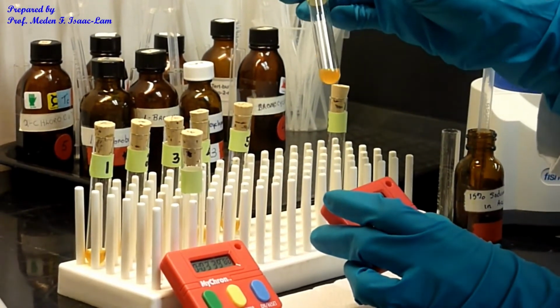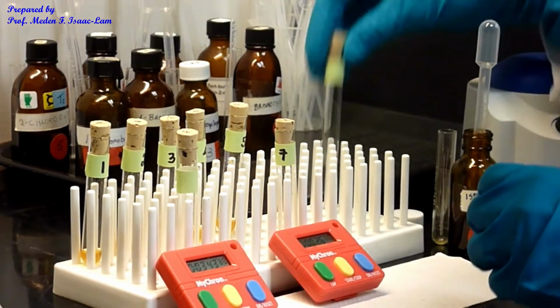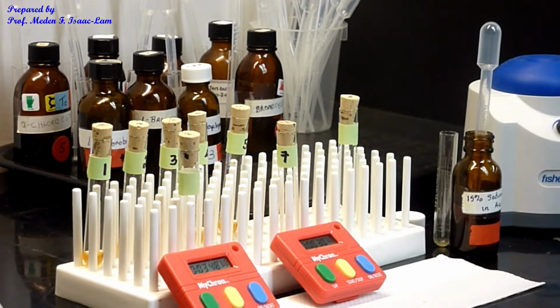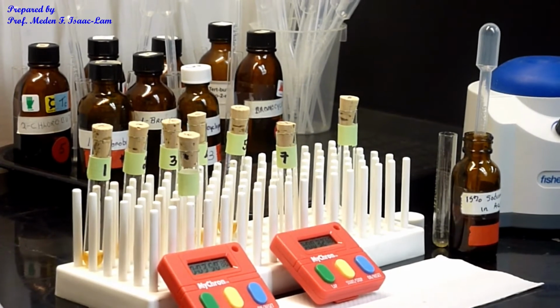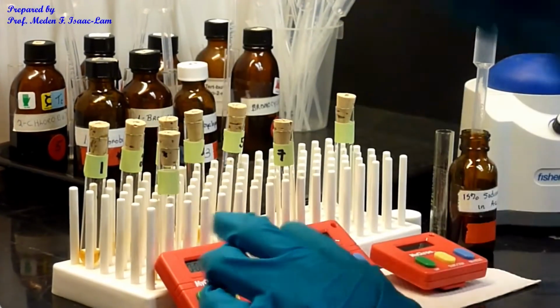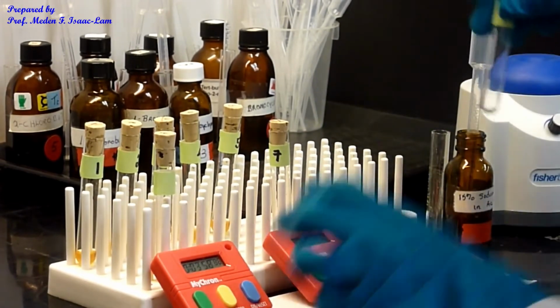Okay, so I don't see anything yet, just started. And then I'm gonna do now the last one. Okay, nothing yet. Okay, so last one.